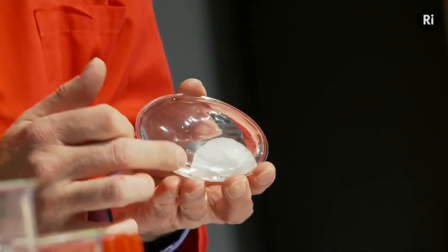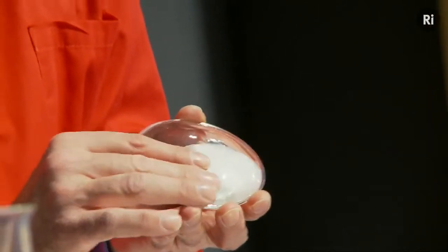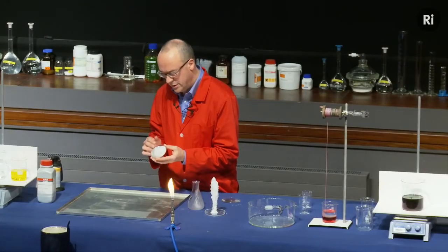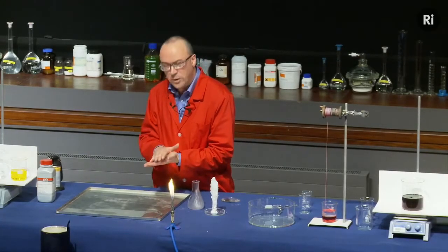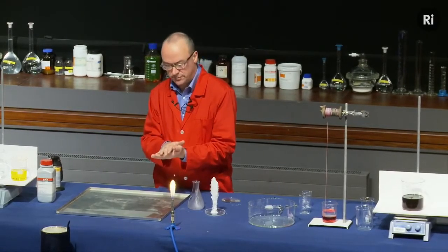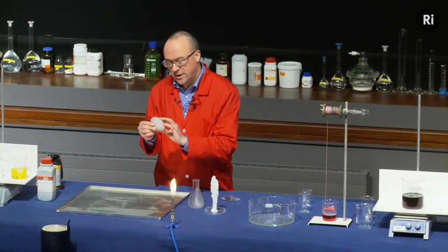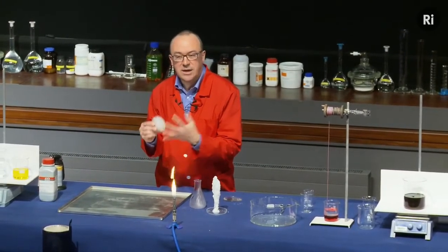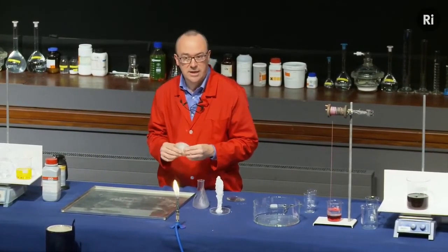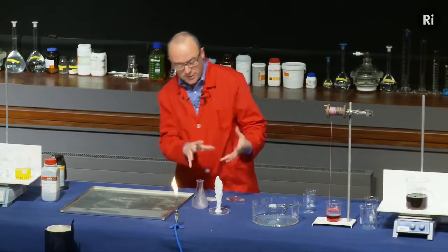And we can see the liquid turning into a solid. And as it does so, it's actually getting warm. So it's actually giving off heat. And there it is, it's turned entirely into crystals. It's become quite warm in the process. I can put that inside my glove and keep my hands warm for half an hour or so. And then I can take this and put it into boiling water for a couple of minutes. The crystals will turn back into a liquid. I can allow it to cool, and they'll stay as a liquid, and it'll stay like that for weeks or months until I'm ready to use it again. I can use it thousands of times. Okay, so that's sodium acetate, a sort of chemical sculpture.